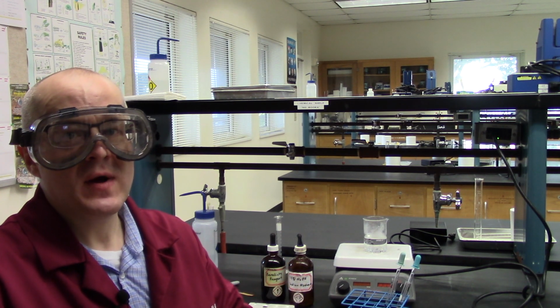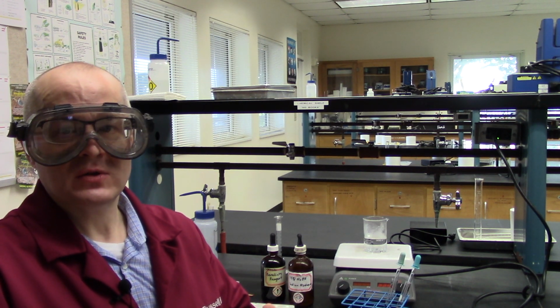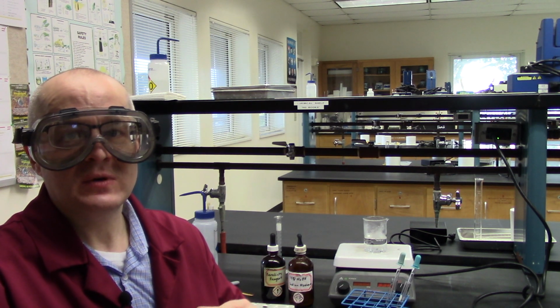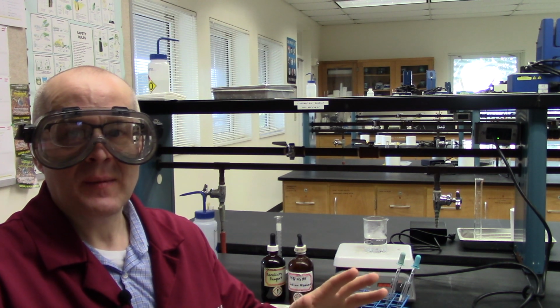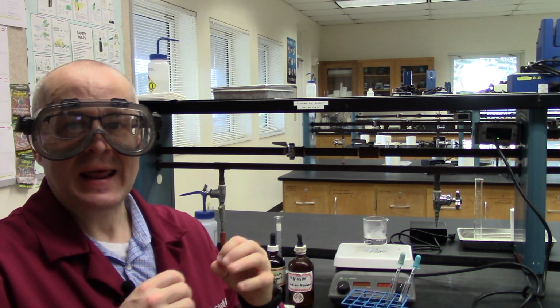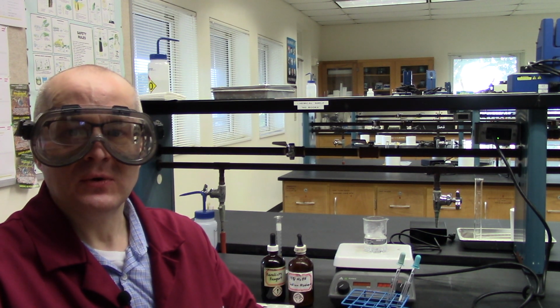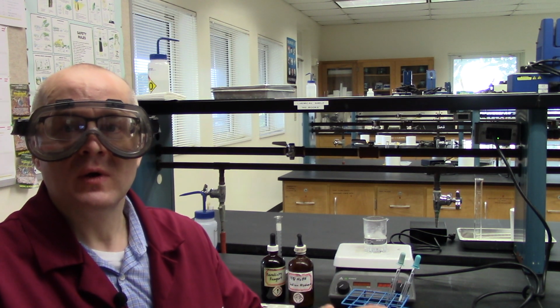Basically, we've learned already that the Benedict's test will turn red in the presence of glucose. We have starch that we heated up in water and acid. We discovered that when heating up a starch in water, nothing happens. The starch remains at the end. When heating up a starch in acid, however, the starch disappears. And what does it disappear to? It becomes glucose. Starches are essentially polymers of glucose.